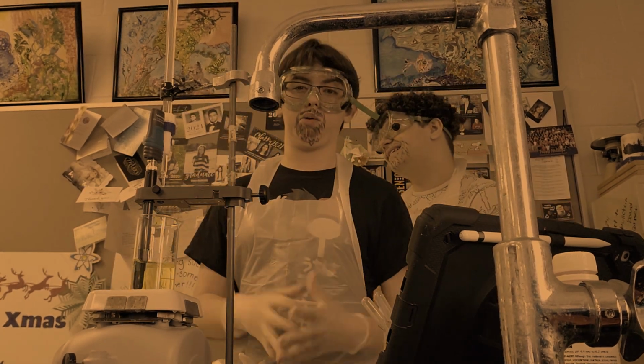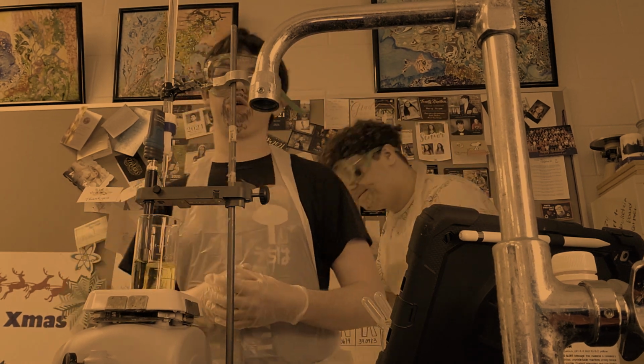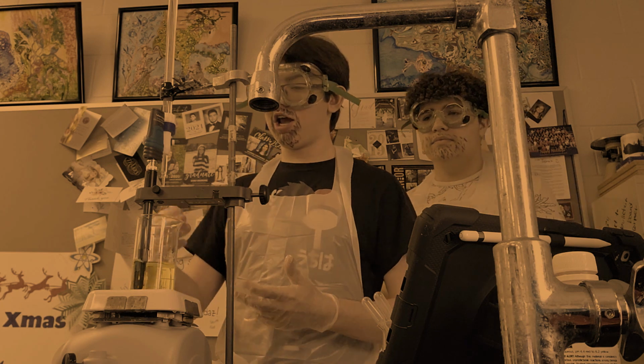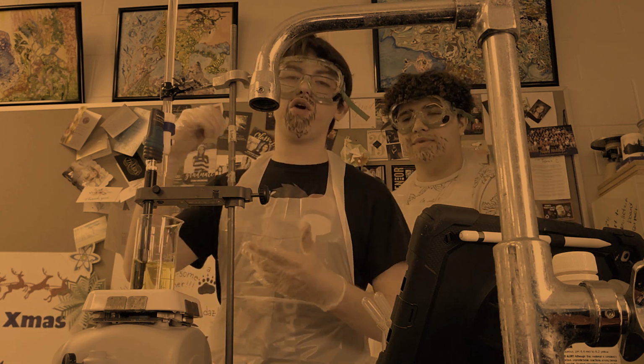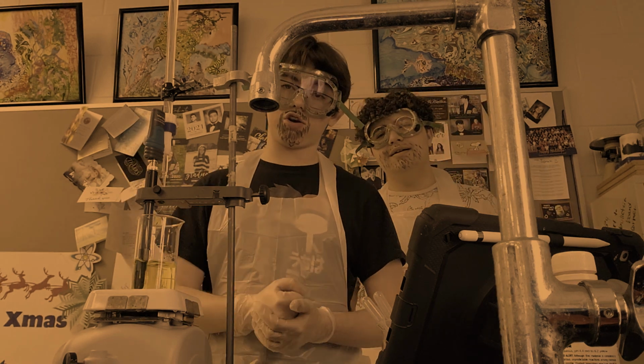As you might have been able to see, or might not have been able to see, I just had a mistake in using the burette. This burette is very sensitive. It is very easy to have a very constant stream of our titrant solution dropped down into the beaker.